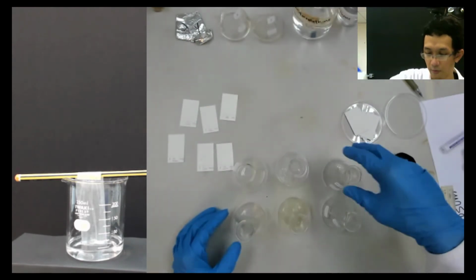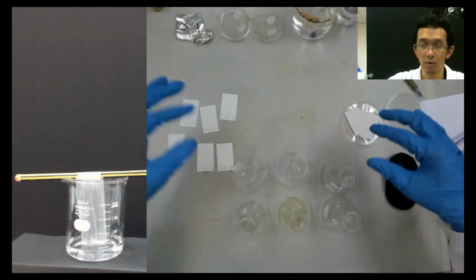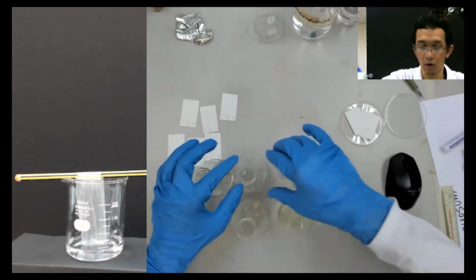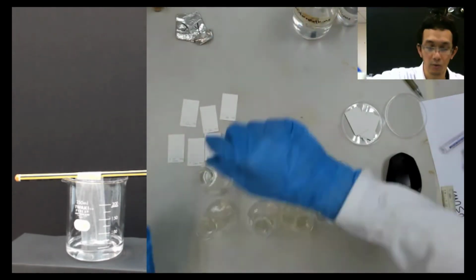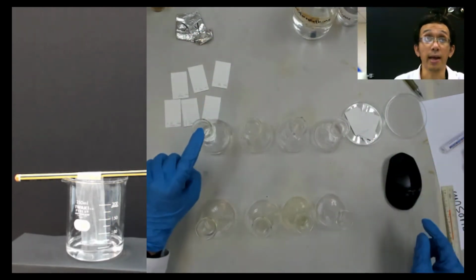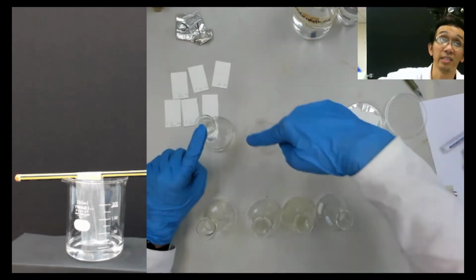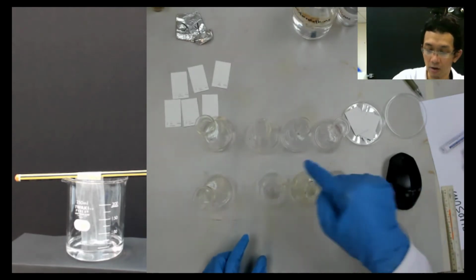So you now have this, group 2, and this is X. Remember, this is X. This is all group 2, known. This is Y. I put it in front because my table is quite messy now. So this is X, and this X comes from any of this, group 2. This is Y, and this Y comes from any of this group.